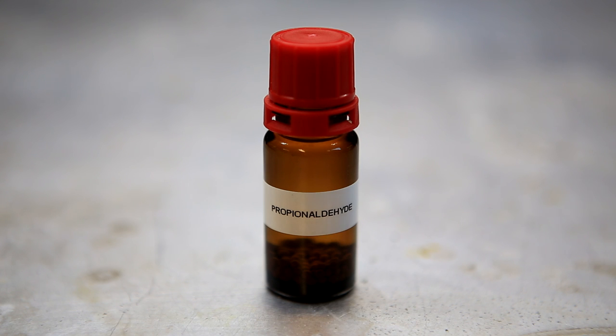The yield of the propionaldehyde was about 46%. The yield is low, but it's consistent with literature which reports a yield between 45 and 50%.